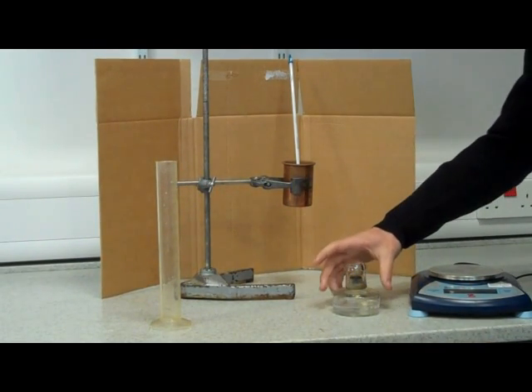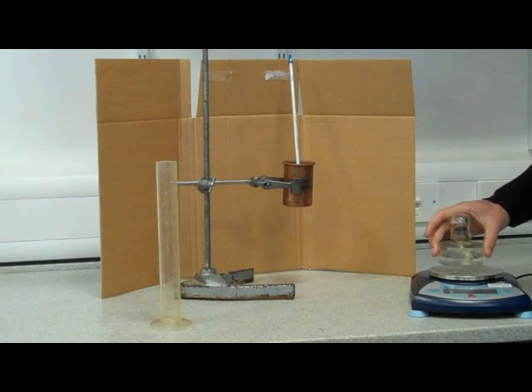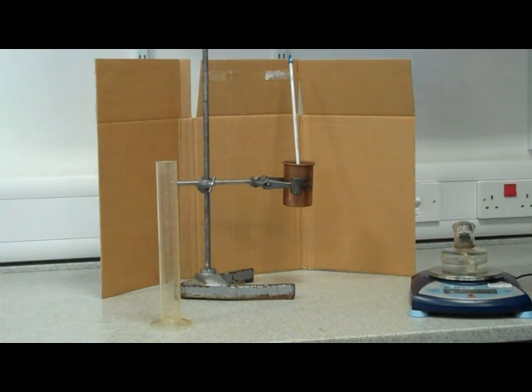We finish by putting the lid back on the spirit burner to avoid ethanol evaporating into the air and weigh the spirit burner again.